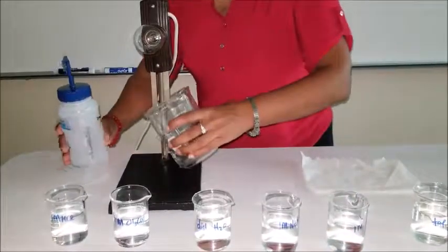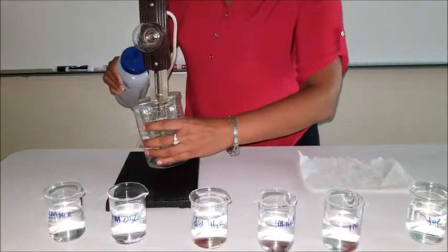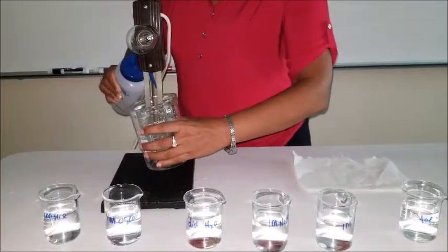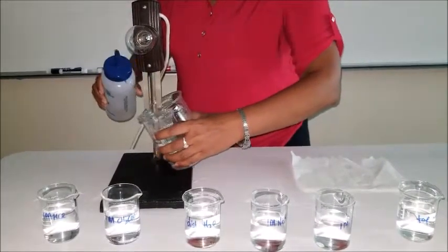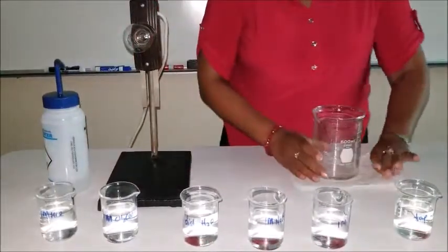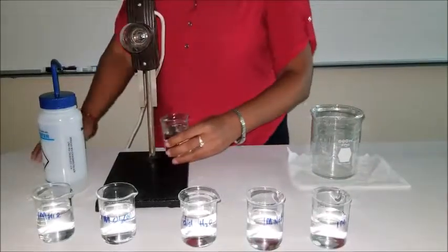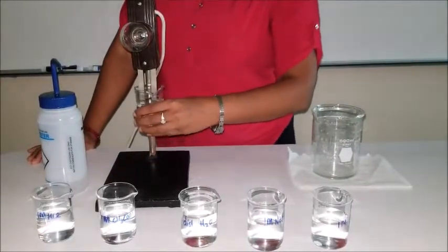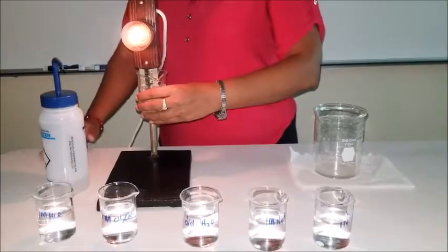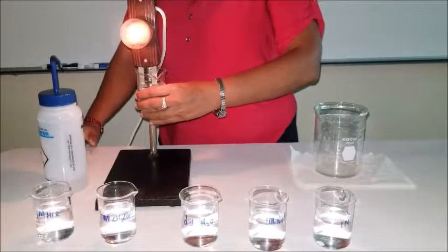Then washing it one last time, because we have tap water to figure out. Tap water is the one that's coming from the city, so technically they clean it up for the most part. You can drink this water, you cook with this water. Now we'll find out if there are any ions in there or not. I hope you can see the light.